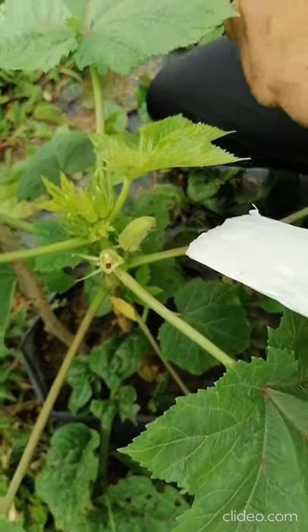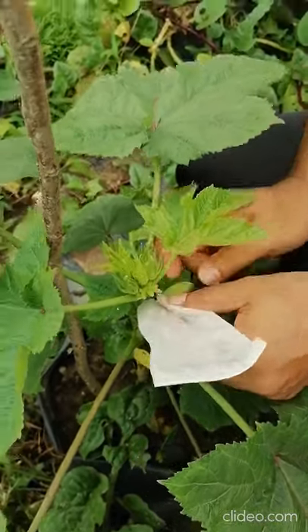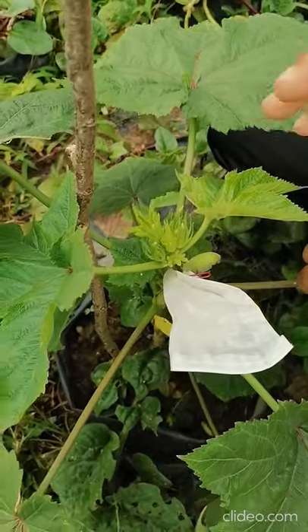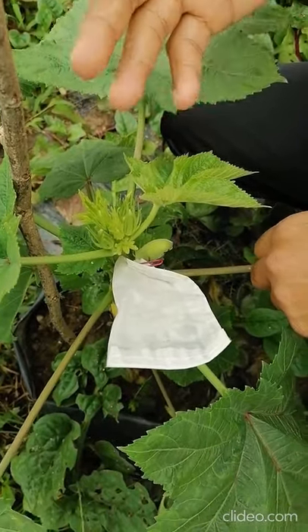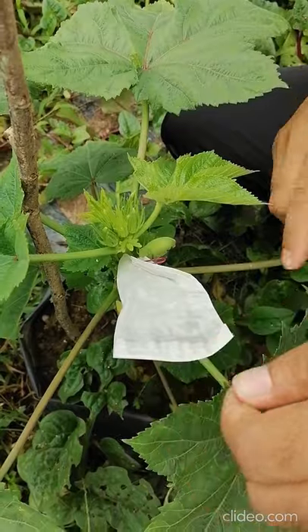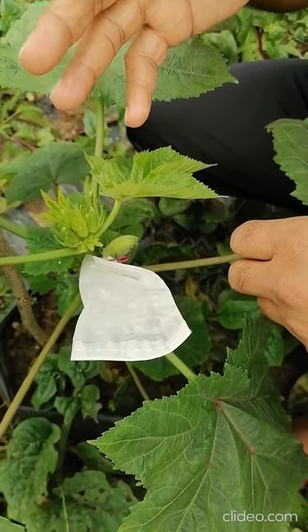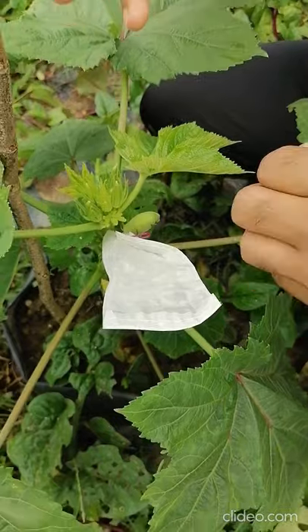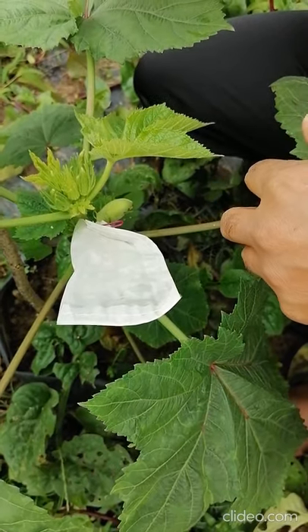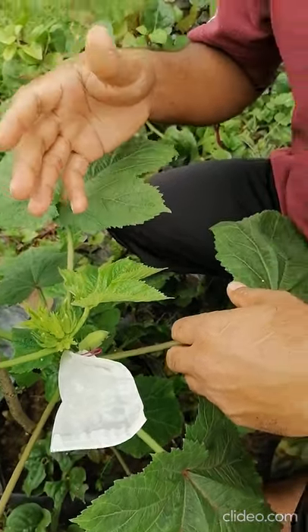We are not sure about the successfulness of the fertilization. When successful, the immature fruits will emerge from there; if not, it will die. For control of undesired pollination, bag again until successful fruiting. After two or three days you can check — if the small fruit has already emerged, remove the bag. Maintain the tag until harvesting and even while storing dried seeds. Next season when you plant the seedling, if the pollination and fertilization were correct, the F1 hybrid will be bigger and all qualities better than both parents.